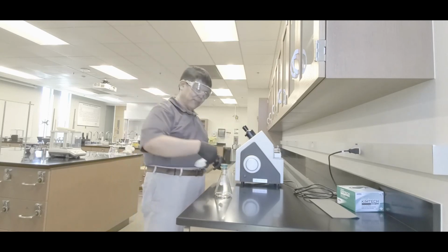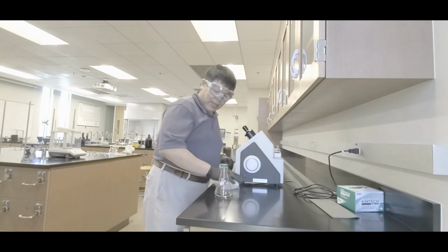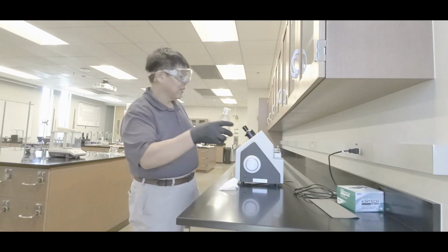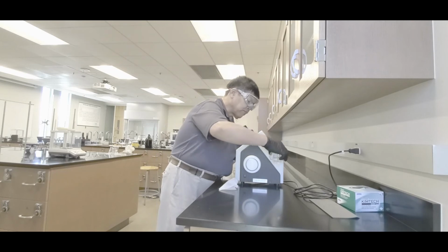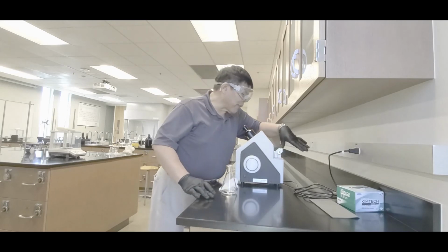So this is what you do. Get a piece of Kimwipe, and what you want to do is dab. Then what you do is this. Hey guys, don't breathe this. So open this, and pour a little bit onto that window, just enough to cover it. Okay. And then close this door and squeeze all the bubbles out of it.